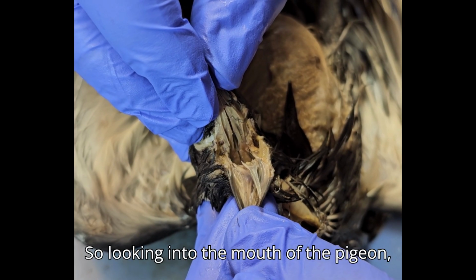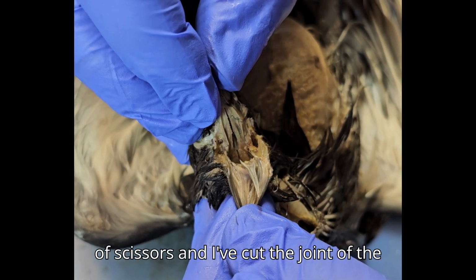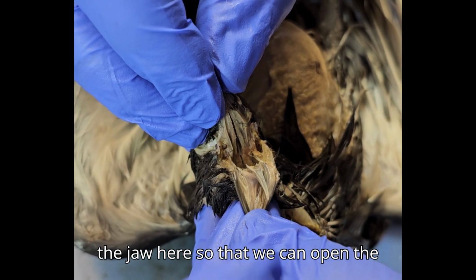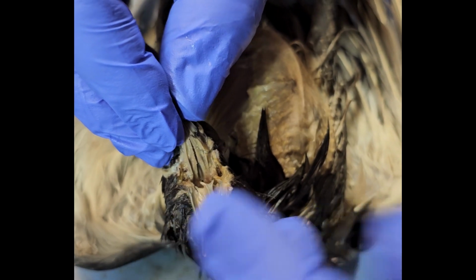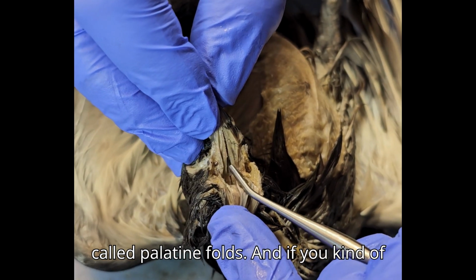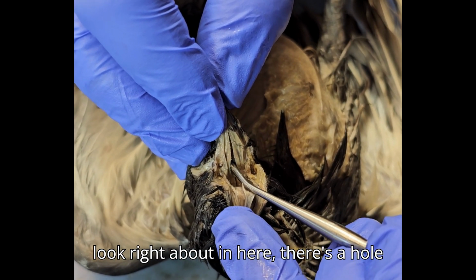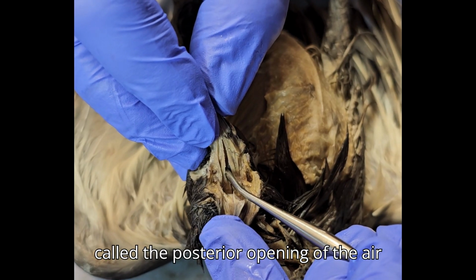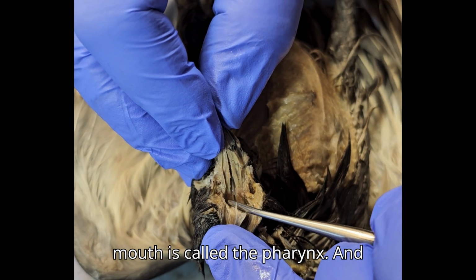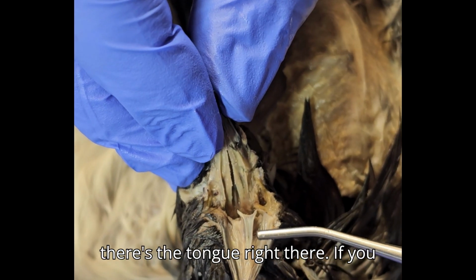So looking into the mouth of the pigeon, what I've done here is I've taken a pair of scissors and cut the joint of the jaw here so that we can open the mouth bigger than it would naturally be possible. In the roof of the mouth we can see these little folds. These are called palatine folds. And if you look right about in here, there's a hole called the posterior opening of the air passage. The back of the mouth is called the pharynx, and there's the tongue right there.